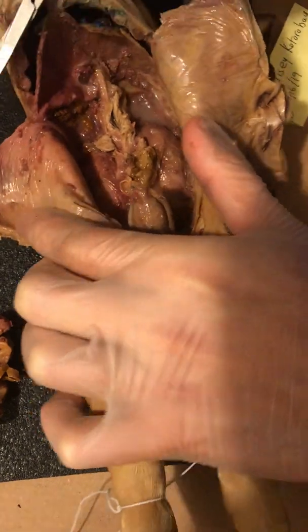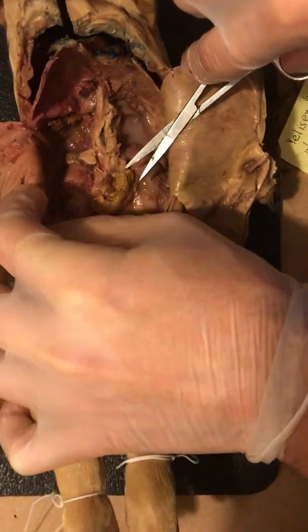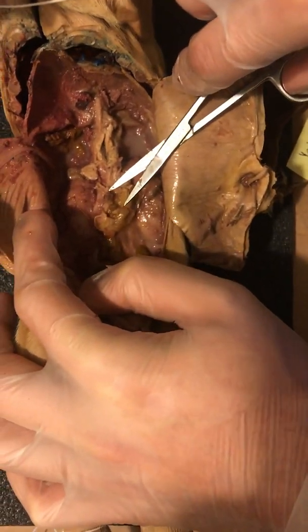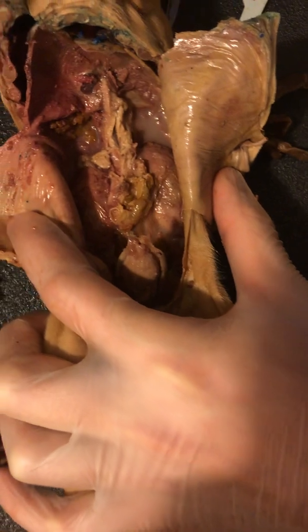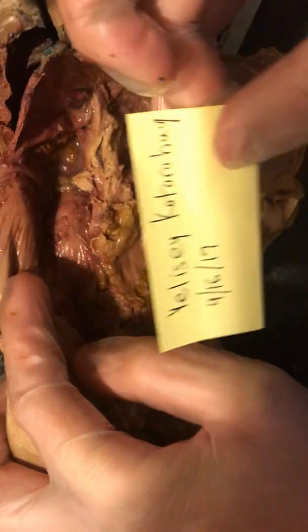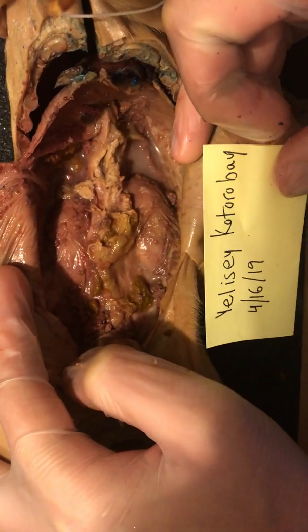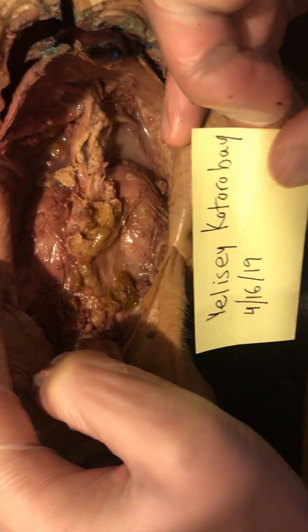Excellent. All right. This will serve my purpose. The first image requires a view of the kidneys behind the peritoneal membrane. As you can see, I'm going to grab my first picture here. You can actually see both the kidneys, the right kidney and the left kidney in there. Perfect.